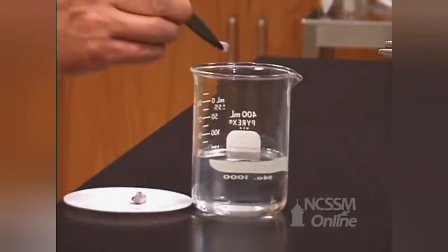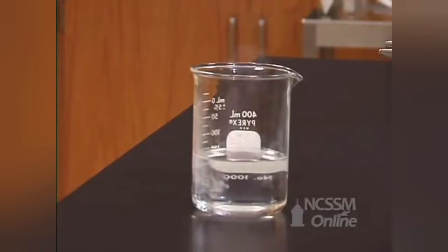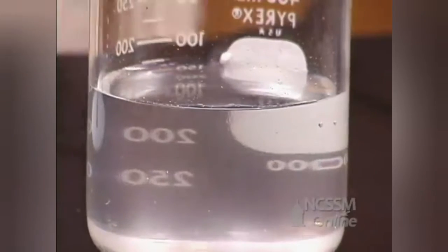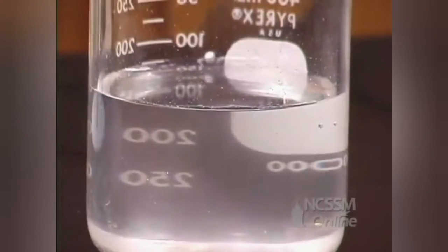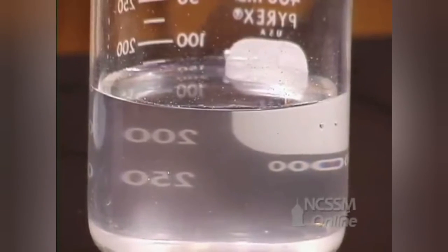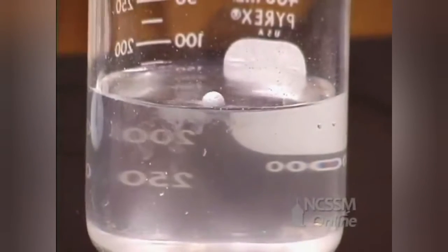If we take a piece of the sodium metal and add it to water, we notice a much more rapid reaction with the water. Like lithium, the sodium is less dense than water and floats. The metal moves across the surface, being pushed by the hydrogen gas that is produced. As you go down the column with group 1 metals, the melting point of the metal decreases. The reaction is very exothermic, which causes the sodium metal to melt. The metal contracts into a very compact spherical form.